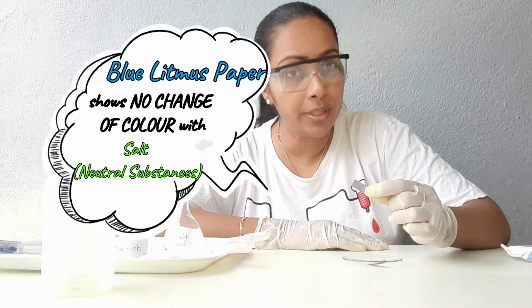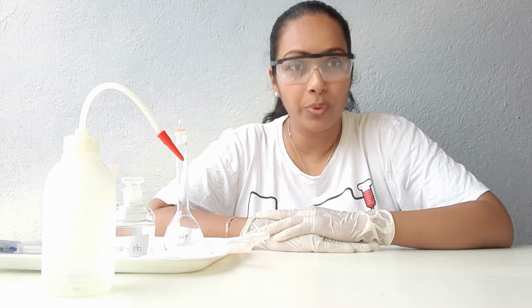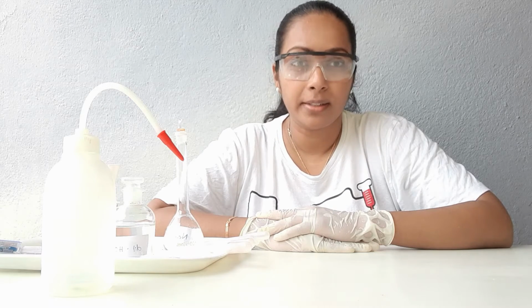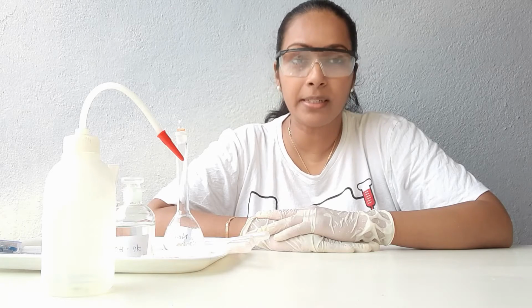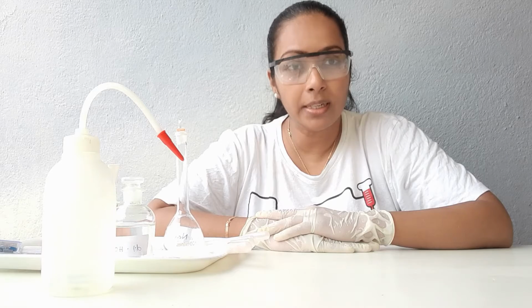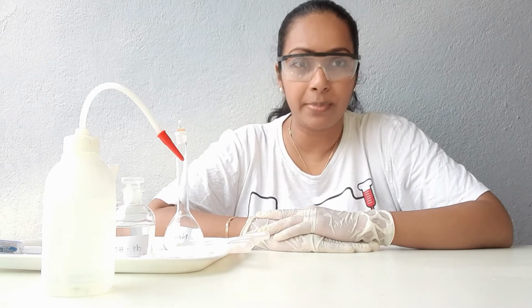Blue litmus also did not change its color. So we know with acids, blue litmus turns into red, and with bases, red litmus turns into blue, and with neutral substances, you don't get a color change with either blue litmus or red litmus.